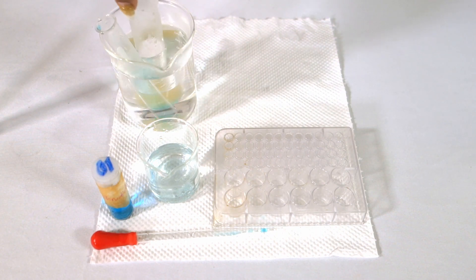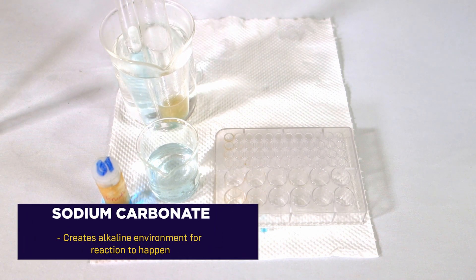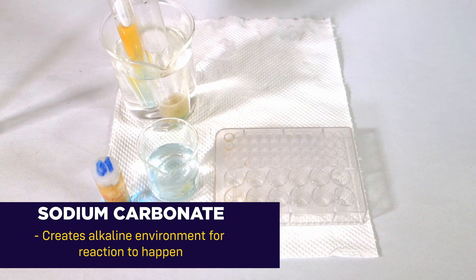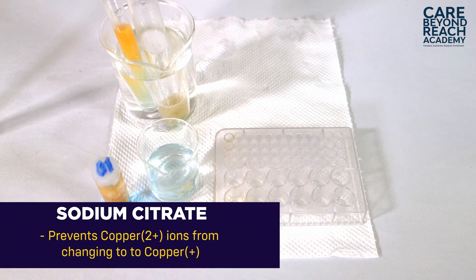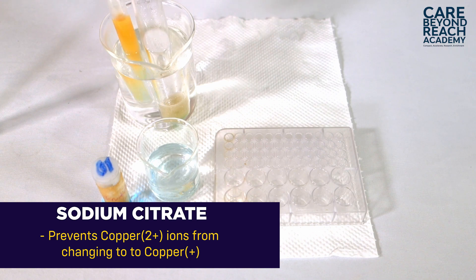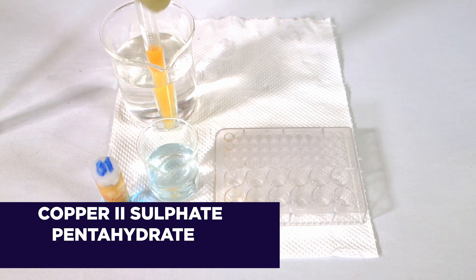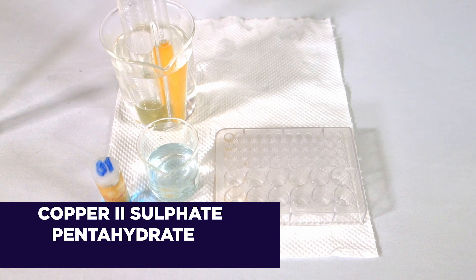The Benedict's solution is a complex mixture which contains three components: sodium carbonate, which creates the alkaline environment for the reaction to occur; sodium citrate, which will prevent the copper 2+ ions from changing to copper+; and copper 2 sulfate pentahydrate. So those are the three components in Benedict's solution.